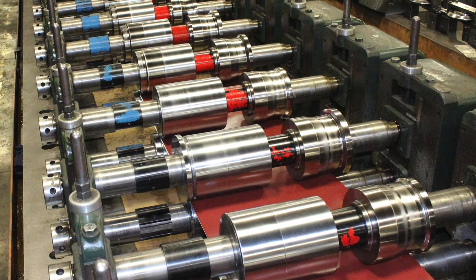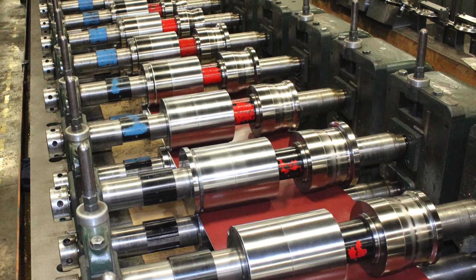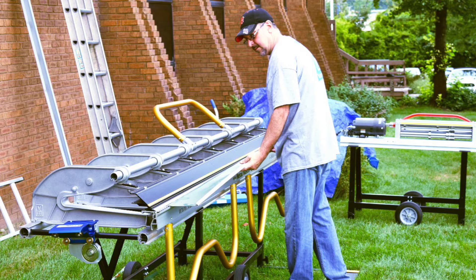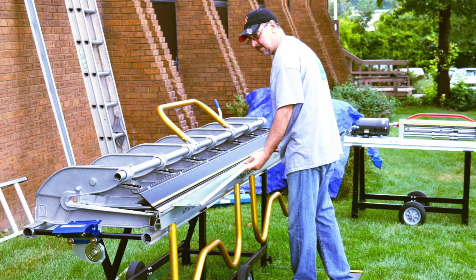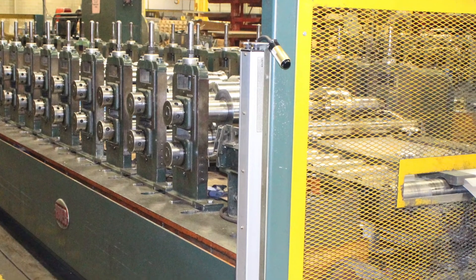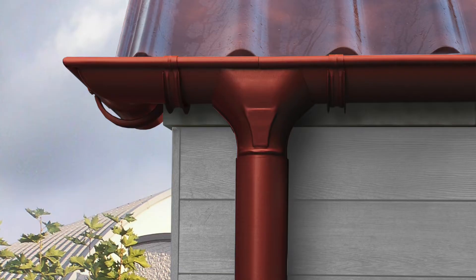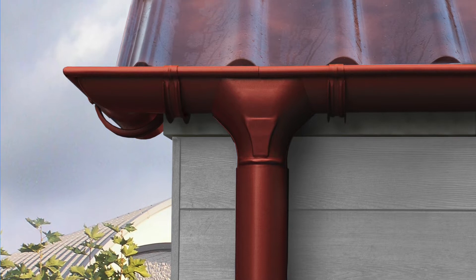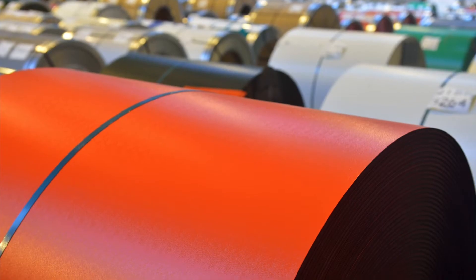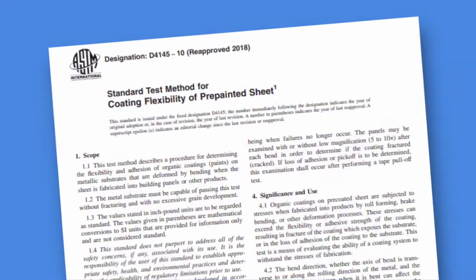Organic coatings on a pre-painted sheet are subjected to stresses when fabricated into products by roll forming, brake bending, or other deformation processes. These stresses can exceed the flexibility or adhesive strength of the coating, resulting in fracture of the coating which exposes the substrate, or in the loss of adhesion of the coating to the substrate.